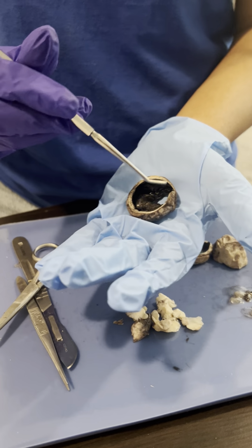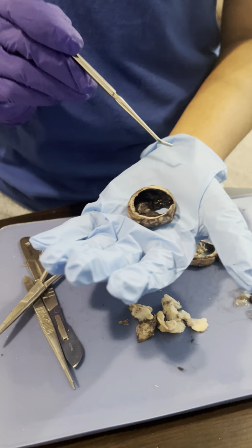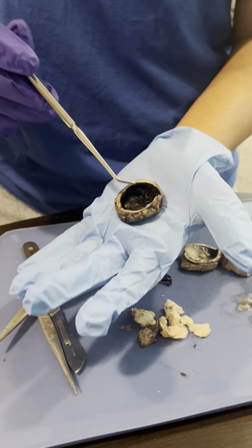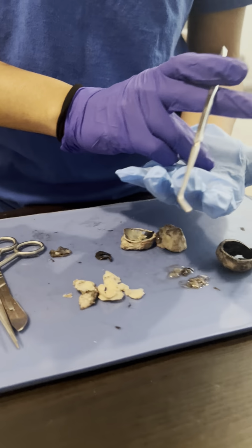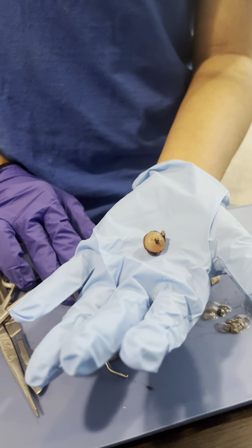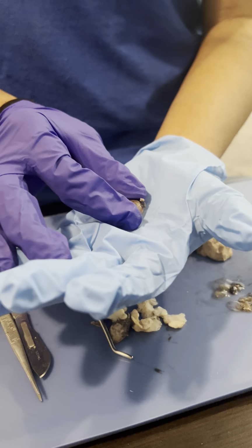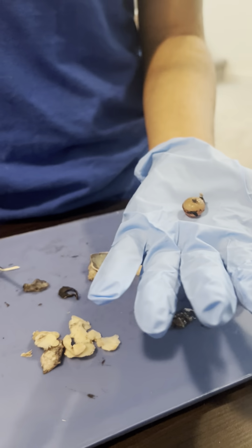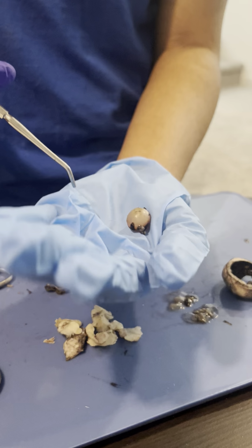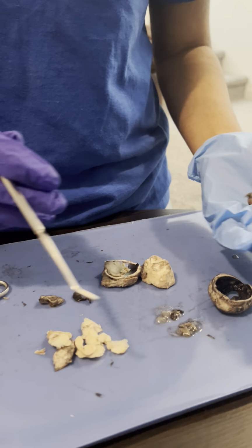Between the back of the lens and the retina, there's also this cavity, and that's called the vitreous body. This is the lens, and the lens is a transparent structure that focuses the light coming into the cornea, which is this structure over here, and the pupil, which is this over here. And the pupil is what lets light in.